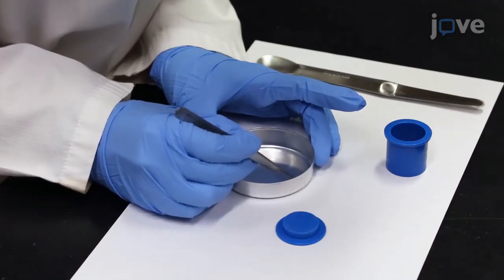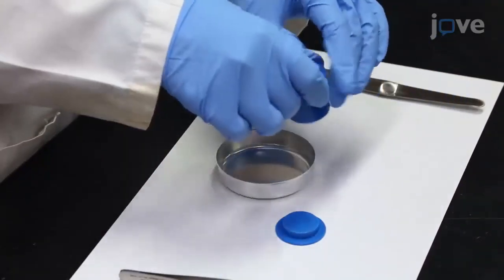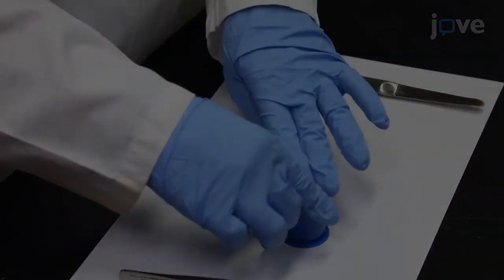Affix the selected ash grains to a piece of clear tape and surround the samples with a 1-inch diameter hollow mold that has been internally coated with vacuum grease.